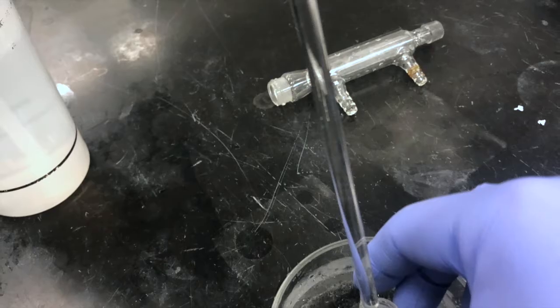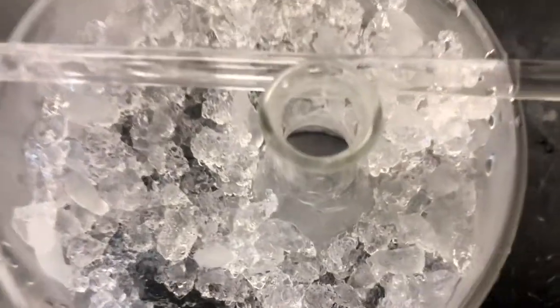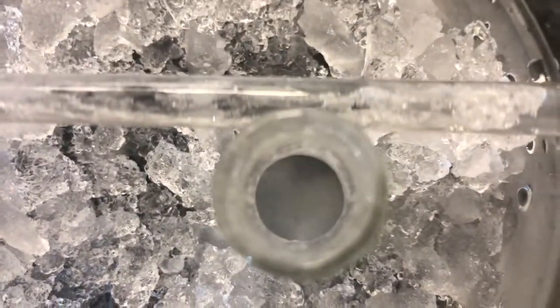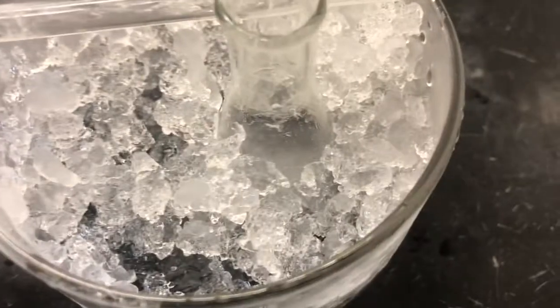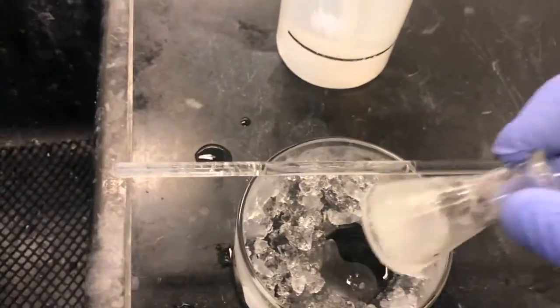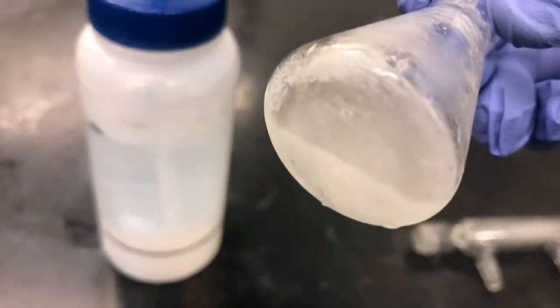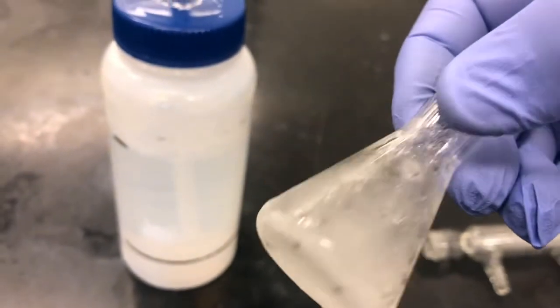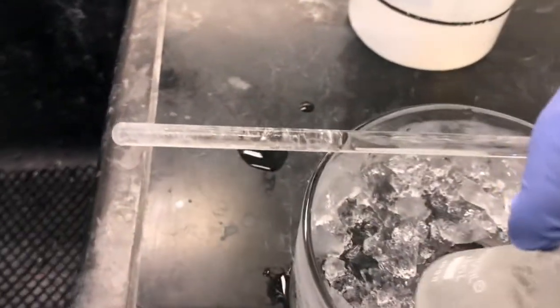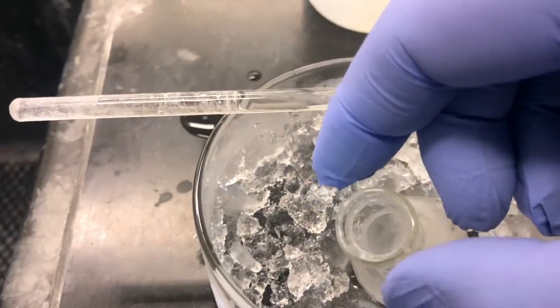So after a long time waiting, decided to put it on an ice bath and start to scratch it. Once it was on the ice bath and cooled down, then we reached a point where the solubility eventually was low enough that the solution became supersaturated and eventually came out of solution. So you can see at this stage that there are significant crystals, but we had to put them on ice to get them to come out. They wouldn't come out at room temperature using the wrong solvent.